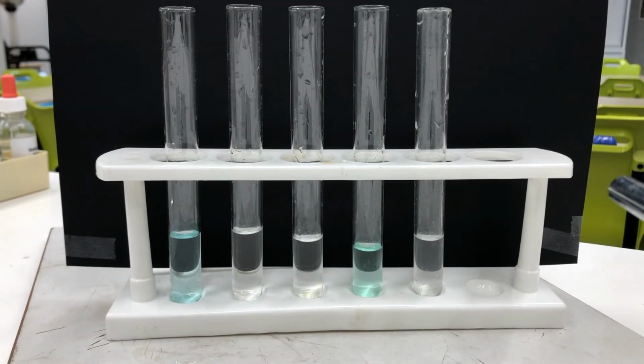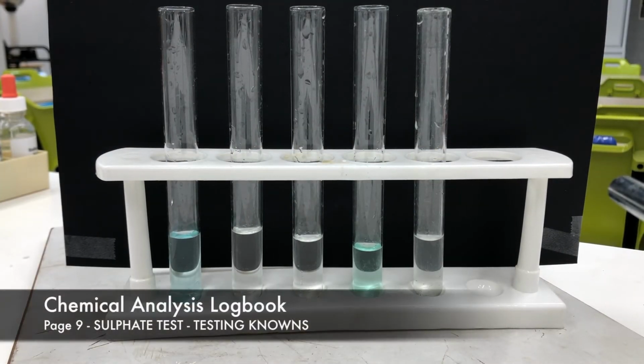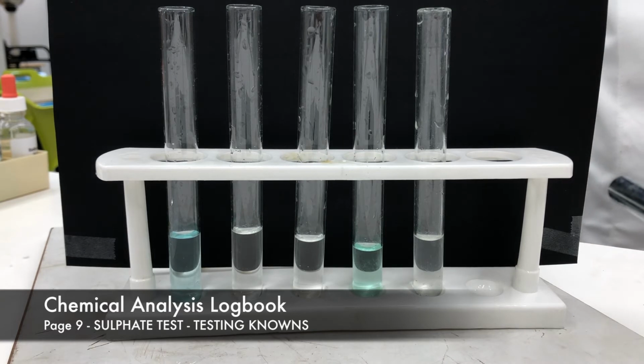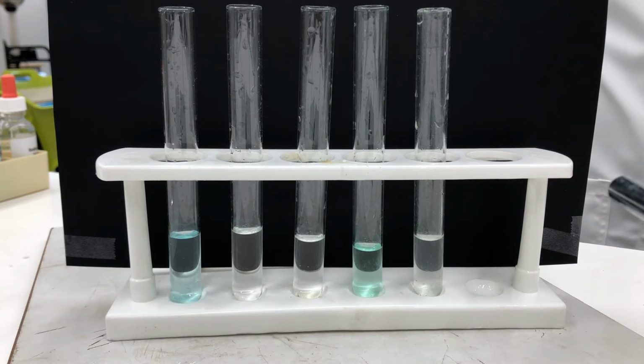We're now undertaking the sulphate test. This is experiment 4. We're testing our knowns. This is experiment 4 on page 9. You'll notice in the results table, we're testing 5 sulfates. We're going to test sodium sulphate, nickel sulphate, potassium sulphate, zinc sulphate, and copper sulphate. Now, I've already added these to our test tube, and I've added a little bit of hydrochloric acid, which just helps with the reaction. They're all ready to go.